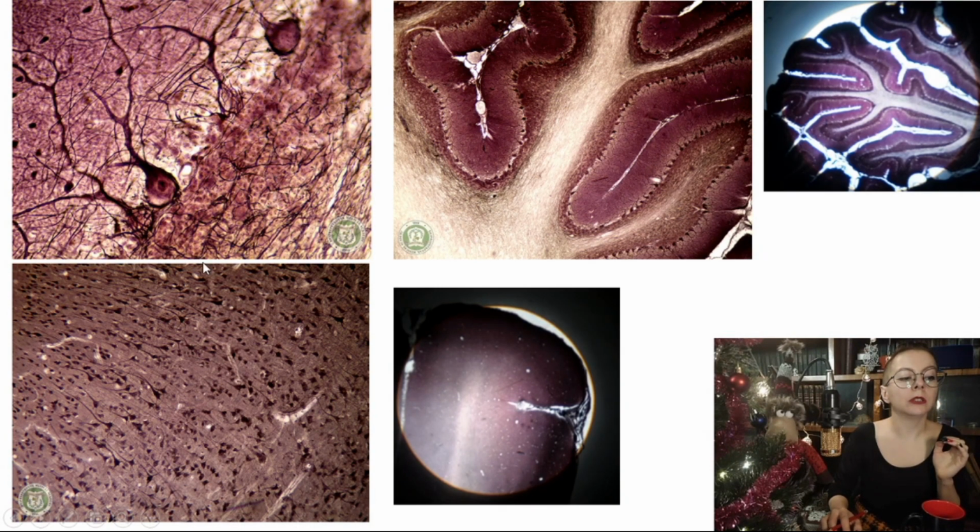And if we are talking about the cerebral cortex with its 6 layers, the borders between them are not distinguishable. They are not exact like lines. So in the cerebellar cortex we can easily distinguish 3 layers. Layers are very distinguishable, and Purkinje cells are very prominent, while in the cerebral cortex of the large hemispheres, we can see cells forming 6 layers without distinctive borders.